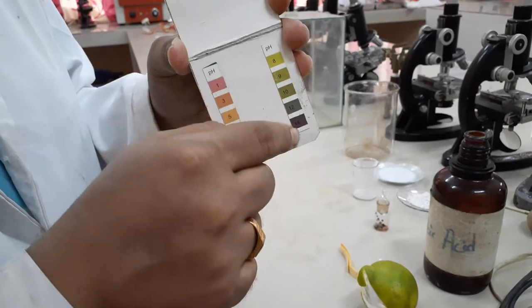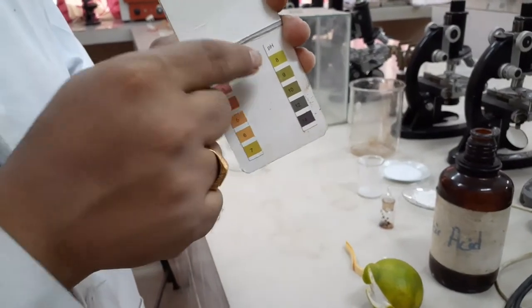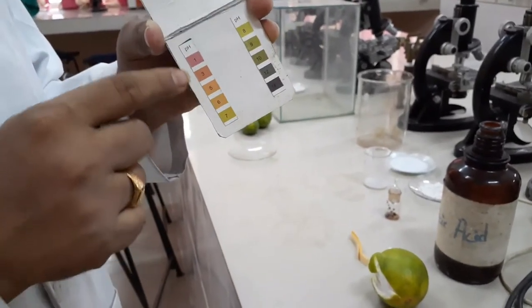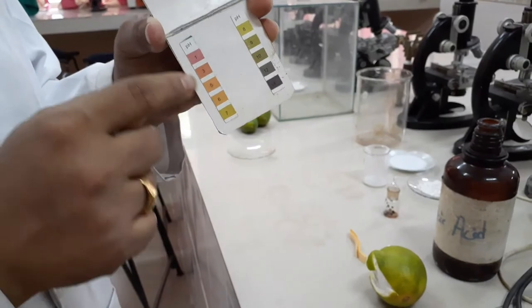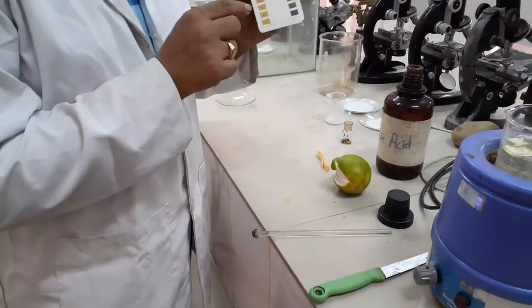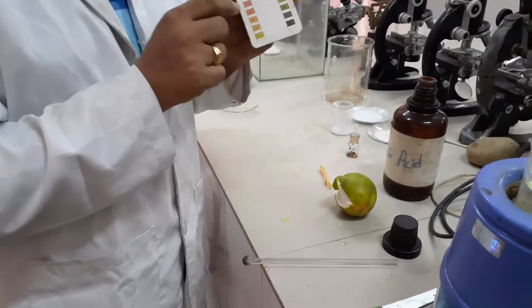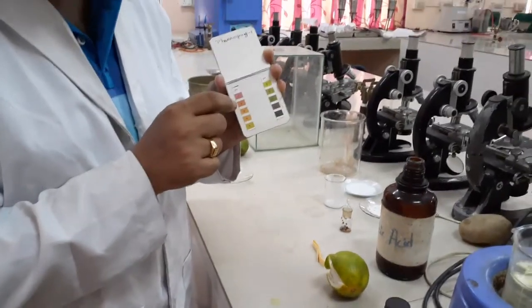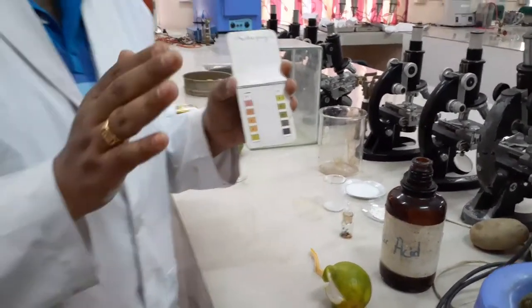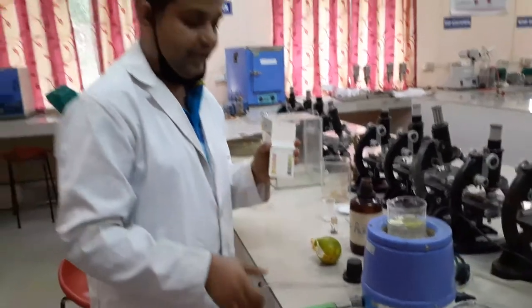This is the basic pH and this is the acidic pH. We have to compare the color of this pH paper. When it is approximately 2.8 — meaning approximately 3, a slightly orange color — then we should immediately stop adding the acid.